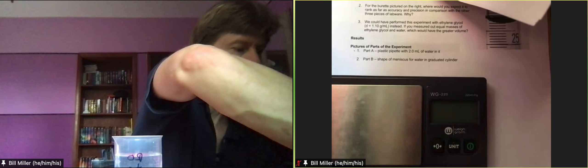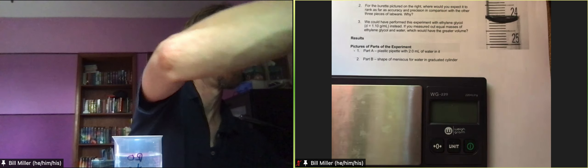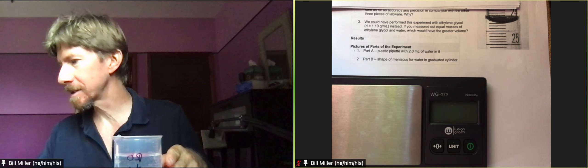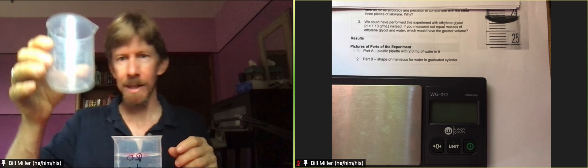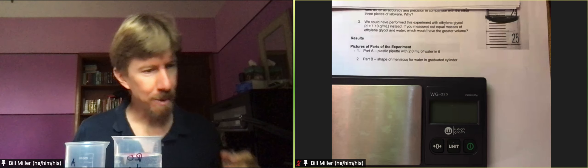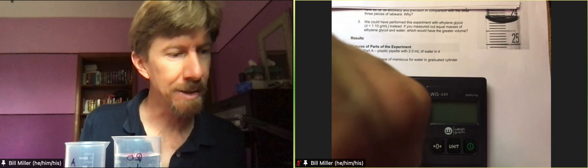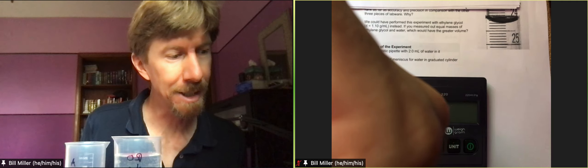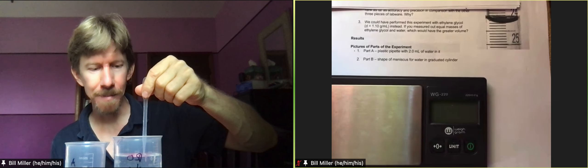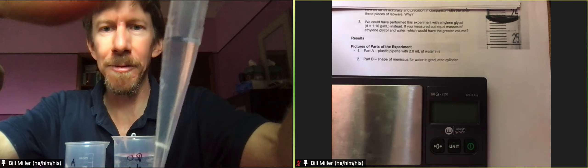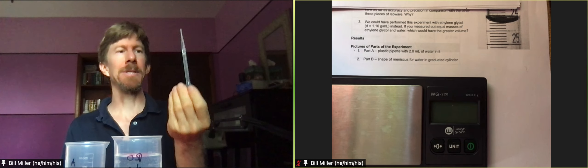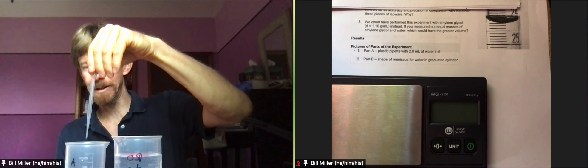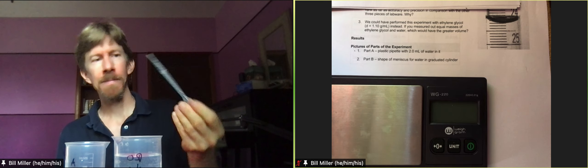Number four says condition the pipette with distilled water, this is a definite skill that we're going to use. I'm going to use this 250 or 300 milliliter beaker to be my waste beaker. When you condition something you're going to rinse the pipette three times with your water such that the distilled water or tap water coats all surfaces on the inside of the pipette. I'm going to squeeze it up, I'm only filling it to right there and there's an air gap that's fine, turn it upside down, let it drain down, shake it out, squeeze it out as much as you can, that's once. Do that three times.